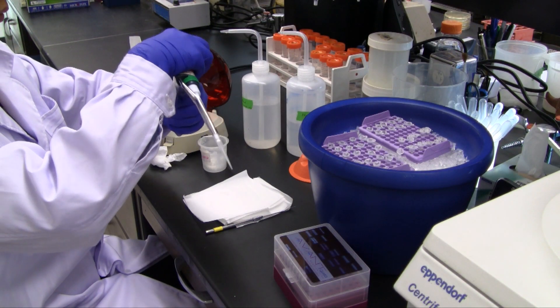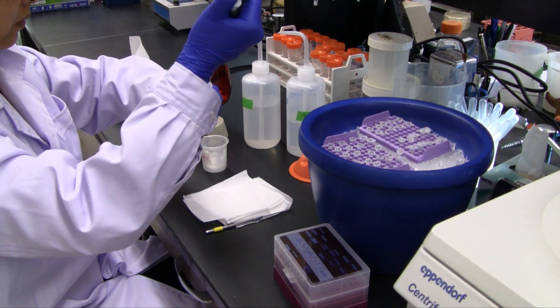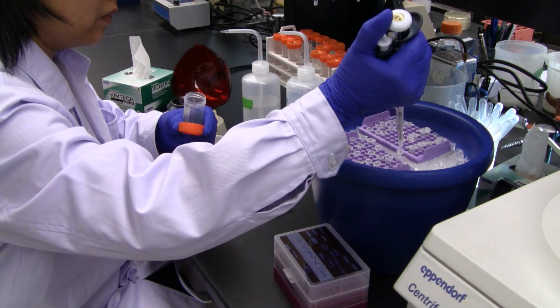After the addition of spreading solution, the cells are resuspended and dropped onto slides as described in the large target video.